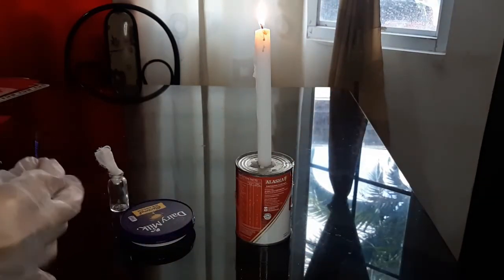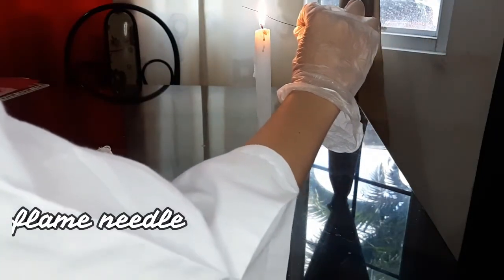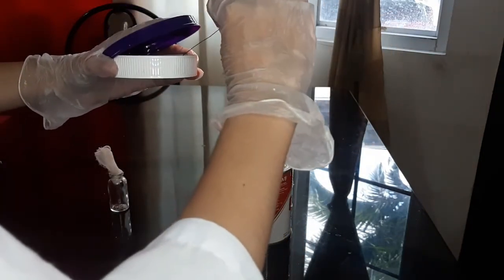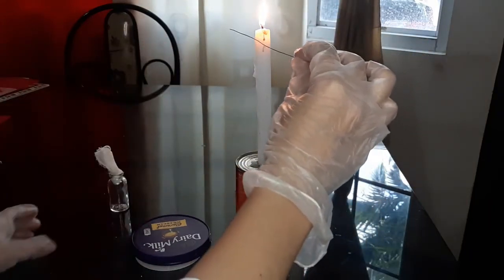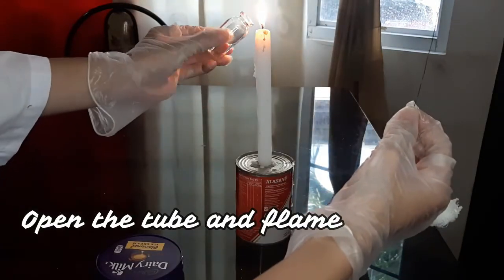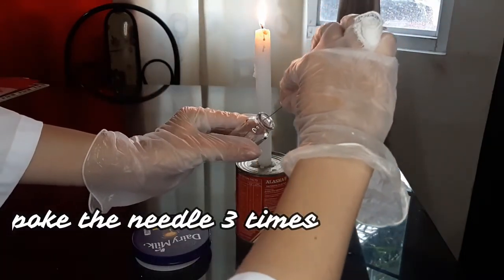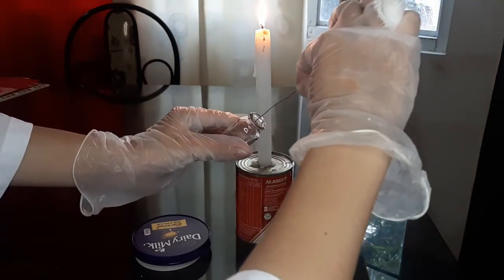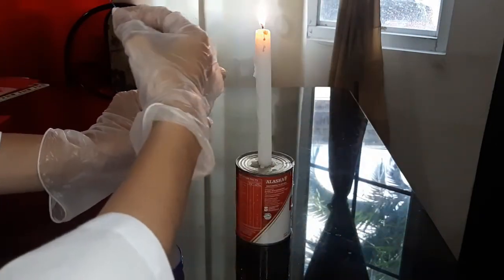For the solid to solid, flame your needle. Gently poke the needle over a colony. Open the test tube and flame. Gently poke the needle 3 times. And flame the tube once more and cover. For sterilization, flame your inoculating needle.